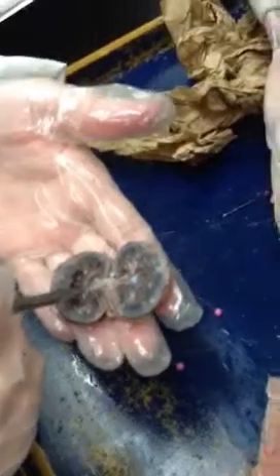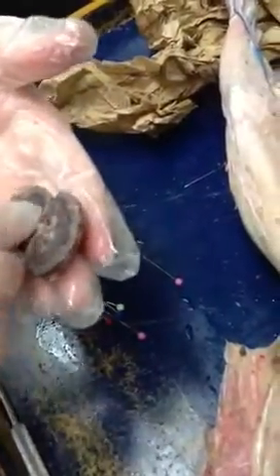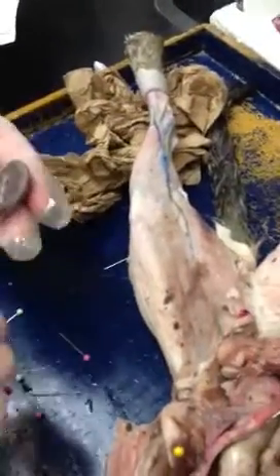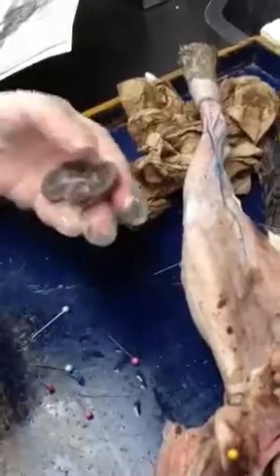Oh, okay, I see where the pyramids are now. Yeah, the little sections. We didn't do that last time. And all in the kidney. Reminds me of the eye. Yeah, I think it's the color. The colors of it and the outer. You're putting everything back in it.